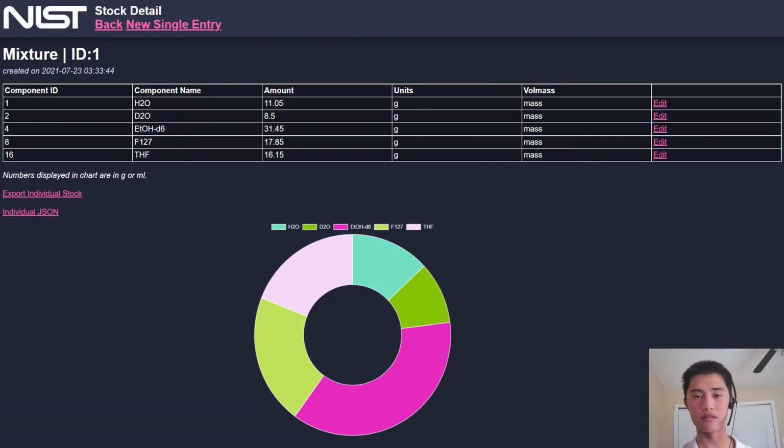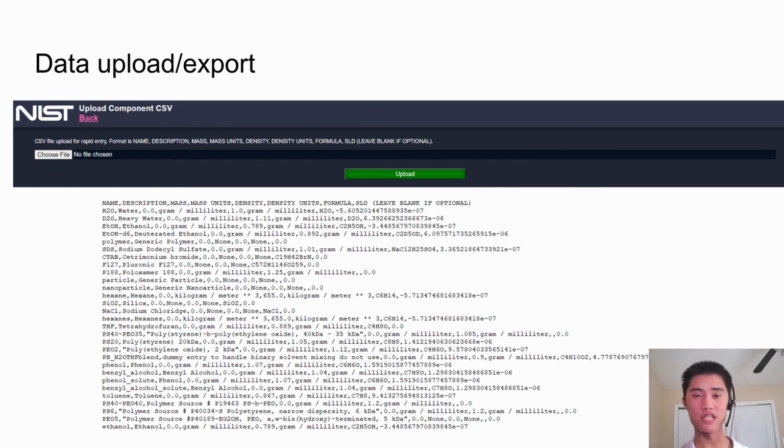After being created, stocks and samples have detailed views that list the information about their respective components or stocks, such as the amount added and units. There is also an interactive chart that visually displays the proportions in the composition. You can also upload and download CSV files for all views. In the image below, I've downloaded all of the component entries. Each value corresponds to the header at the top of the file. When uploaded, entries will be created or updated as necessary.